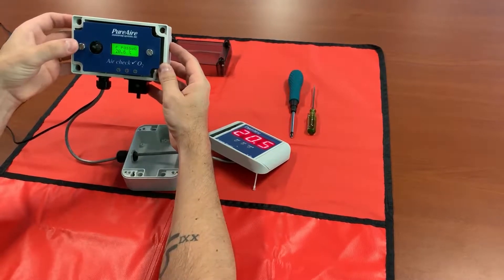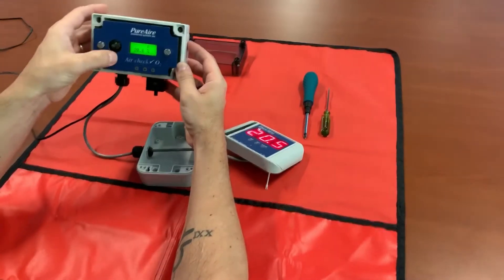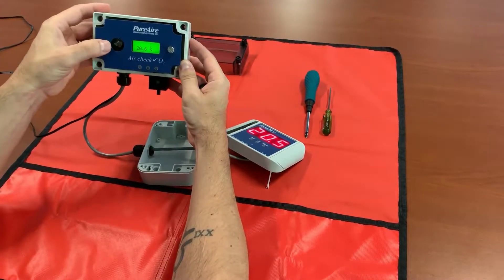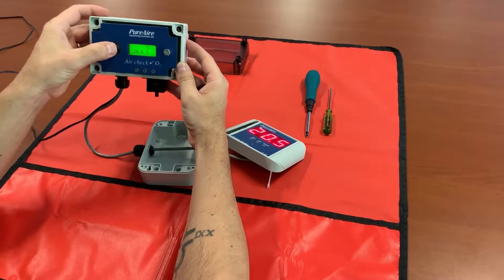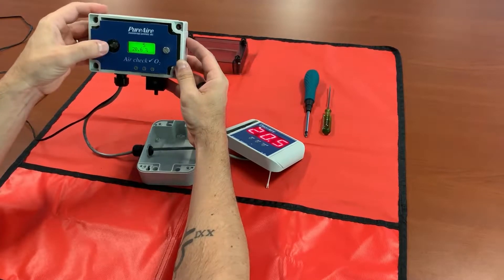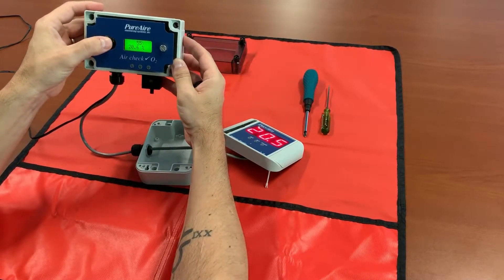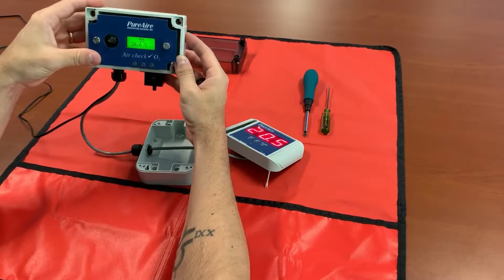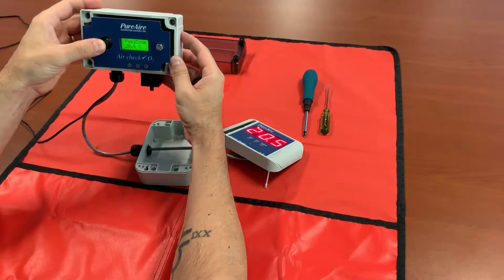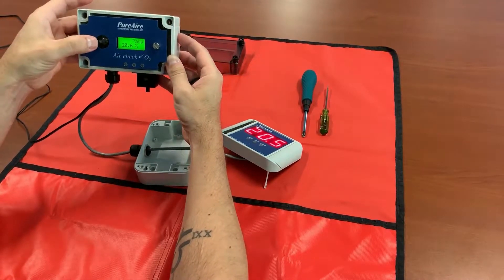Go to the right once on the joystick — it'll say 'enter password.' Right again and you'll have a flashing A. Go ahead and hold up on the joystick until you get to the number 5, then move to the right. Go to number 5 again, then one more time and up to 7. This is your password — you want to have a flashing 7. At this point push the joystick straight in and you'll get 'passcode OK.'